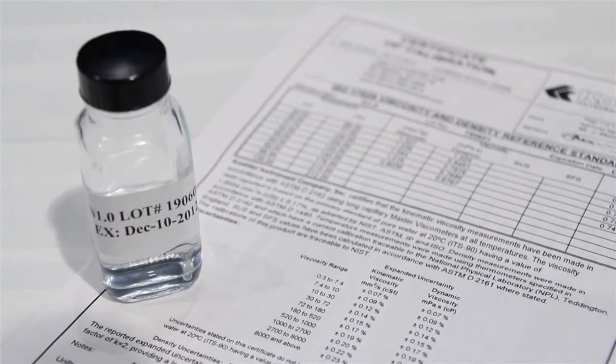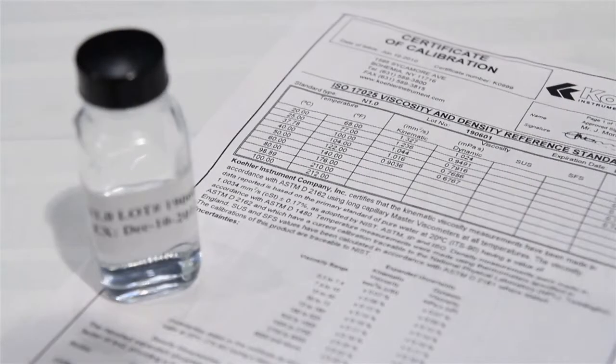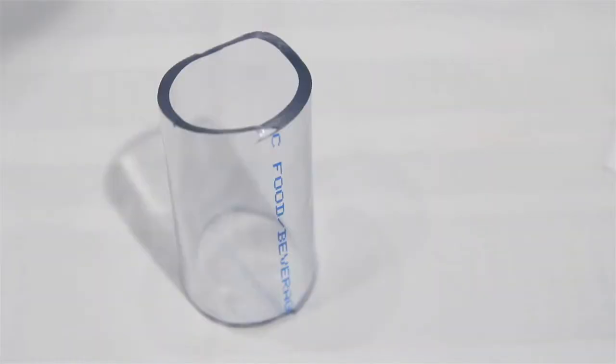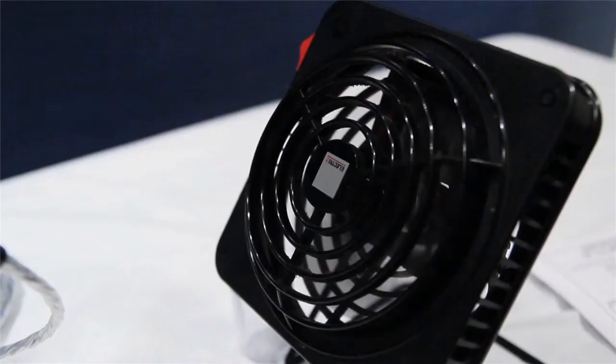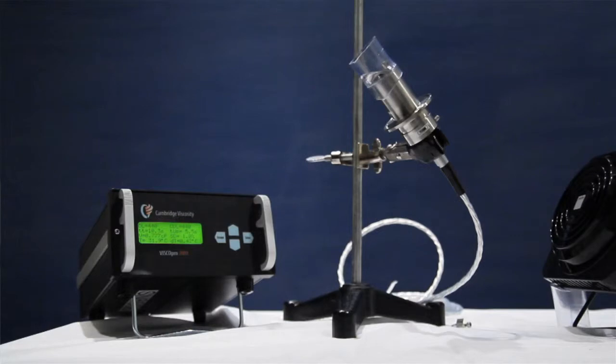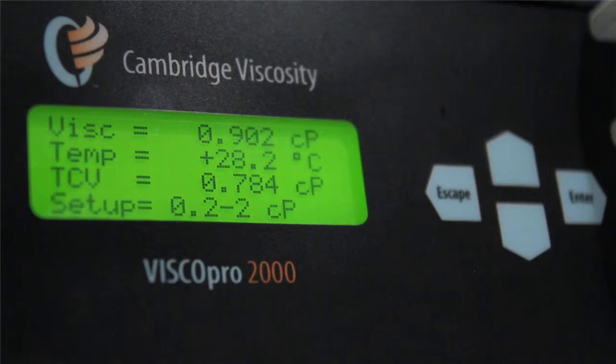Up-to-date calibration fluid with tables. 1.25 inch tubing to create a fluid reservoir. A fan. Your Cambridge sensor and electronics. The sensor and electronics are symbiotic. Each electronics box is calibrated specifically to a sensor and a piston.